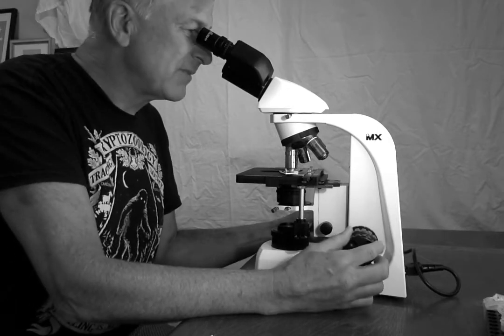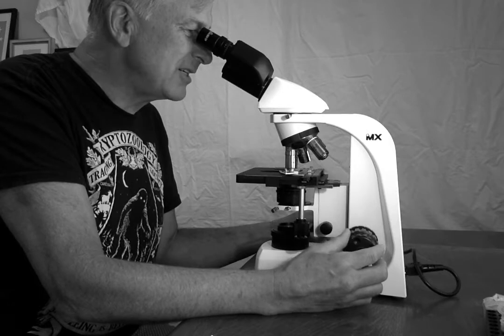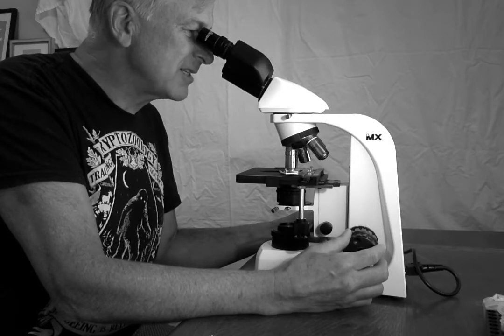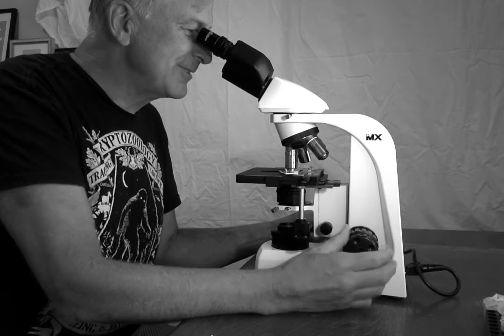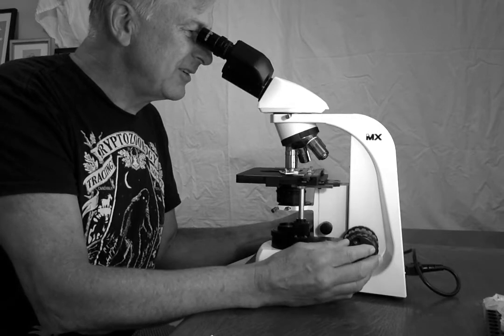So hopefully, well, it's a little fuzzy, but not much. Just barely adjusting the fine adjustment knob gets it in focus. I'm seeing all kinds of little cool stuff. Maybe nuclei. I don't know.